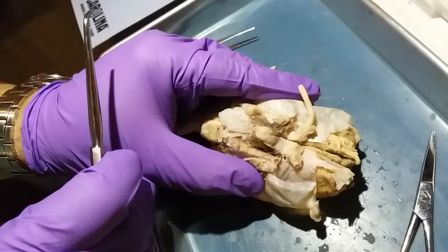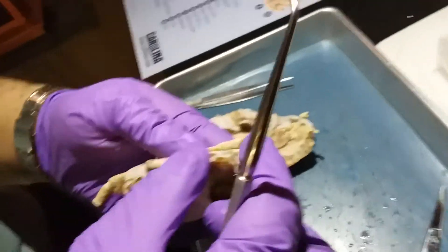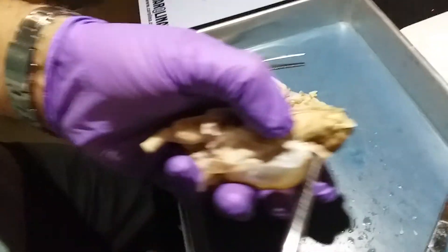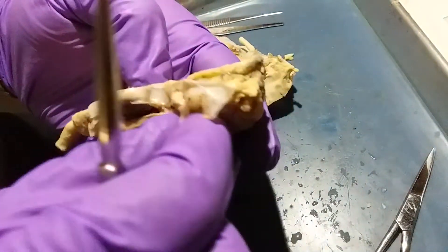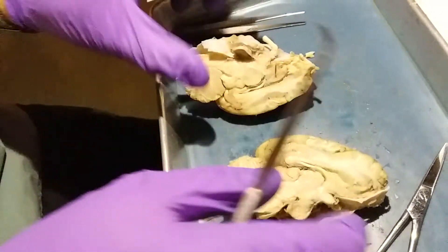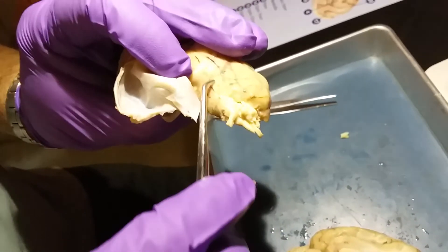The olfactory bulb is going to be right underneath here. This structure right here is the olfactory bulb, which gives rise to the olfactory tract, which is back here. On this side you can see part of the olfactory bulb and the olfactory tract.